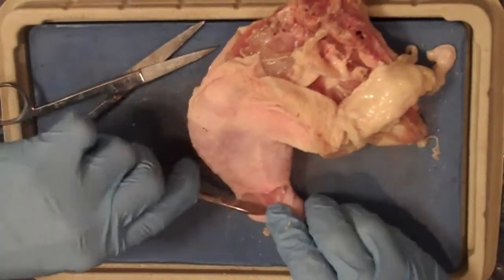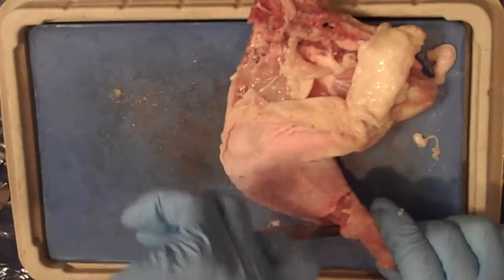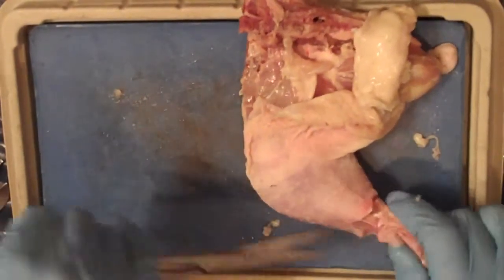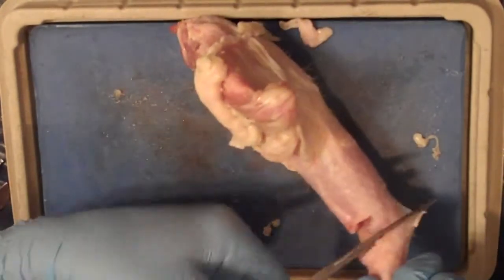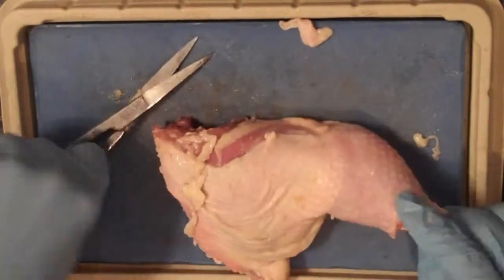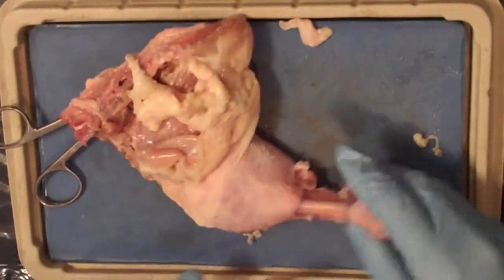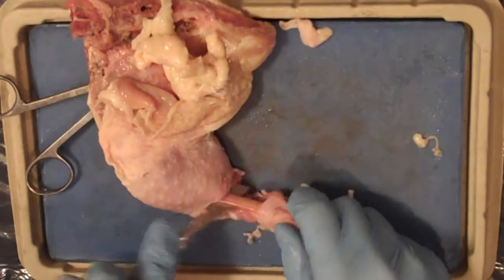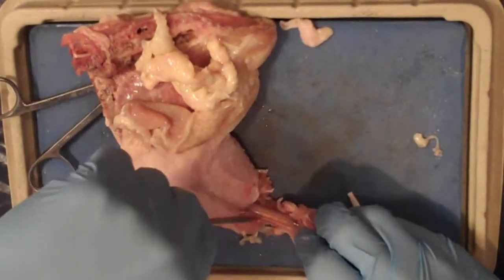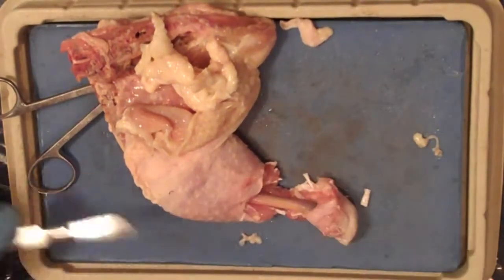Next, you're going to want to use your scalpel to expose a piece of bone. The chicken you're using may not have a leg bone. If it only has the thigh, then do the same thing, exposing a piece of bone on the thigh. When you see it, try cutting into it, pick it up, feel it, notice how firm the texture is and how strong and sturdy it is. Remember, that's due to the osseous cells, which have an extracellular matrix with large, thick fibers that are sturdy. And inside of those fibers, in between the spaces, there's calcium deposits that give it its strength.